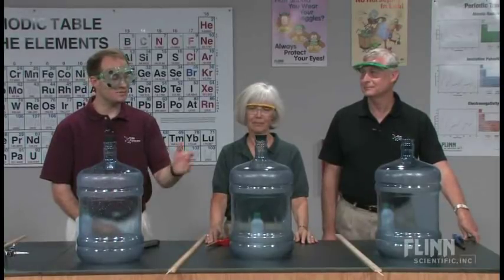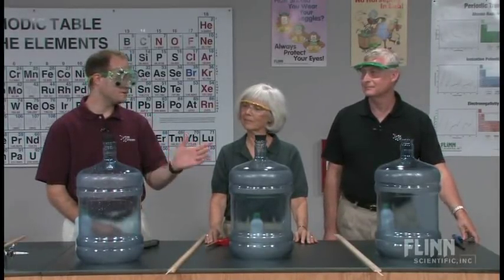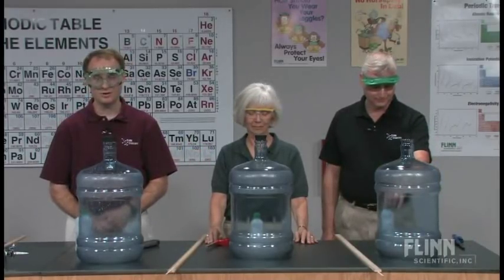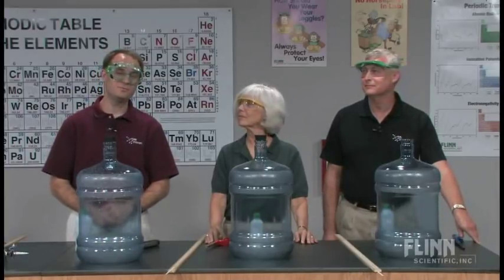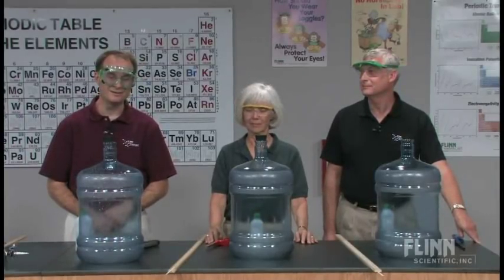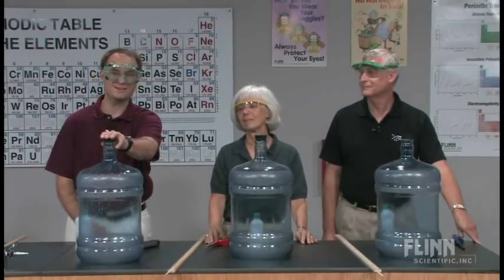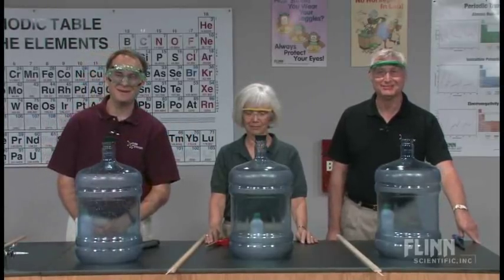Kathleen has the advantage of no water in her isopropyl alcohol, whereas Steve has a slight advantage in the slightly greater vapor pressure of ethyl alcohol, but hindering Steve would be the 5% water. So it's almost a race — I fully expect to finish third, but these two should indeed be neck and neck. I guess we'll find out.